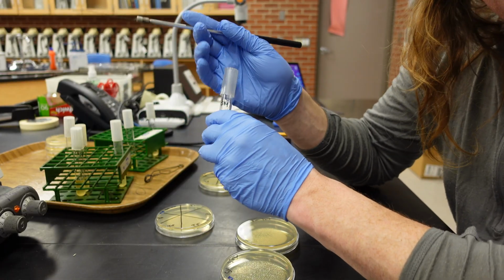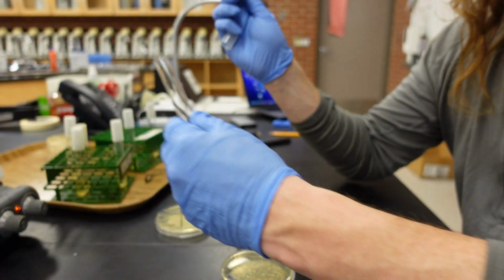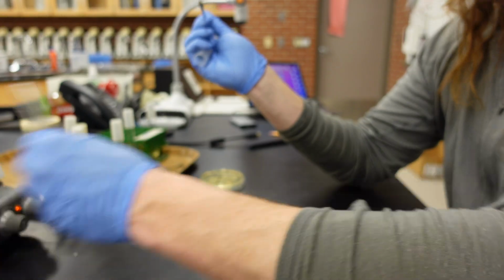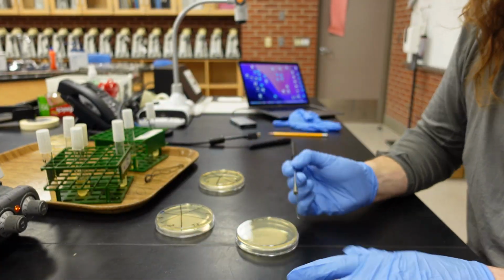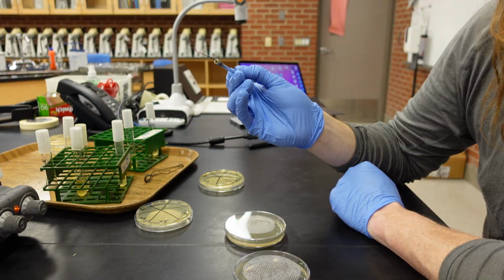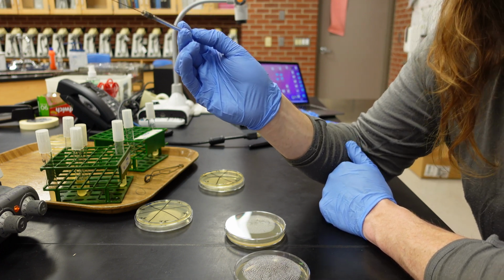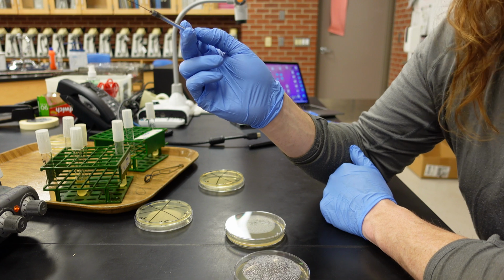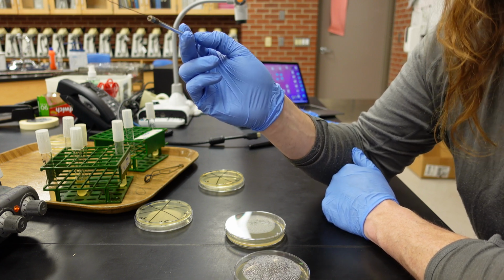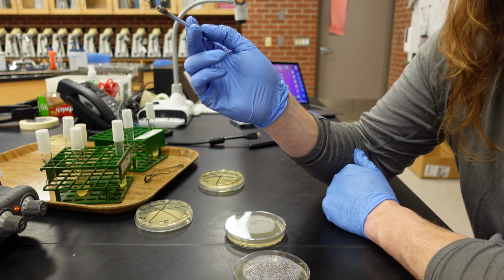So phenotypic variation can be observed in Serratia marcescens. It's one of the few bacteria that can produce a bright pigment, most commonly a red pigment. Serratia marcescens is commonly found in the intestine and is often found in the soil, and it causes about 2% of nosocomial infections of the bloodstream, lower respiratory tract, urinary tract, surgical wounds, skin, and soft tissues of adult patients.